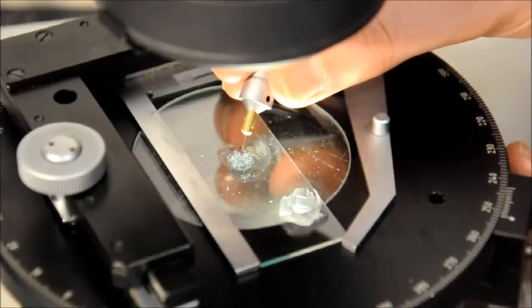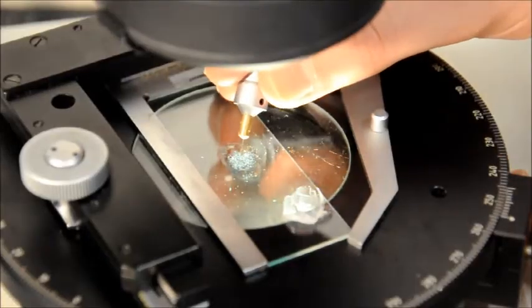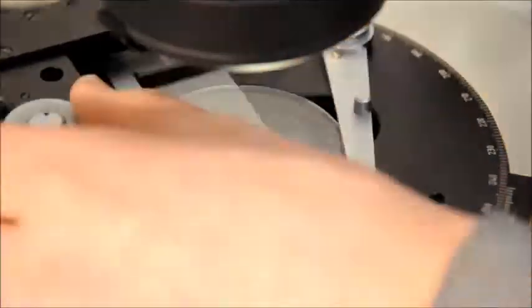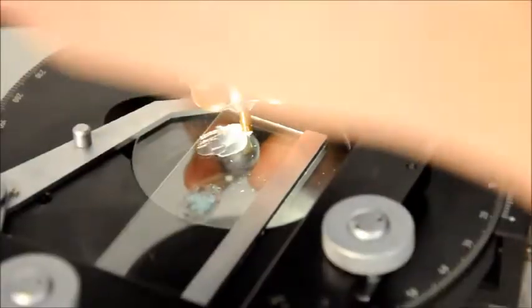Having selected your crystal, you should transfer it into wax, seen here on the end of the microscope slide. The wax makes sticking the crystal right on the tip of the pin far easier.